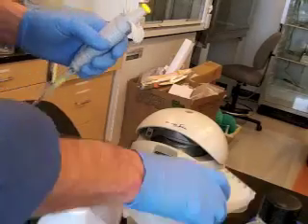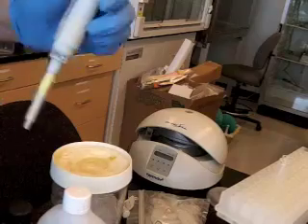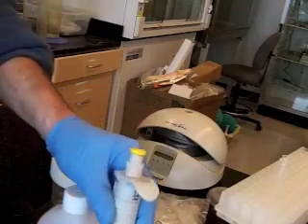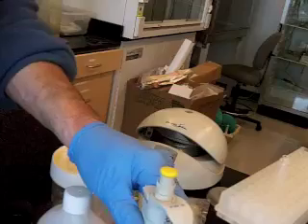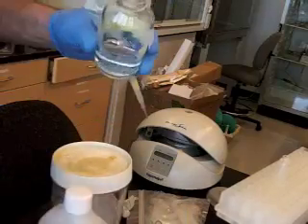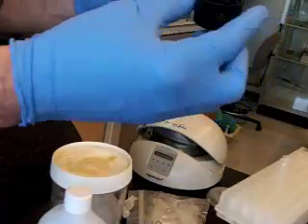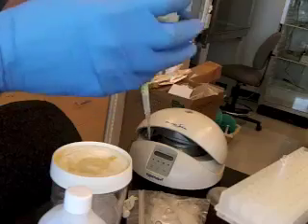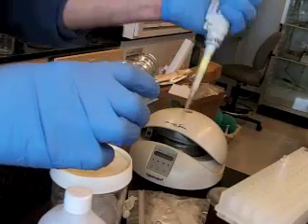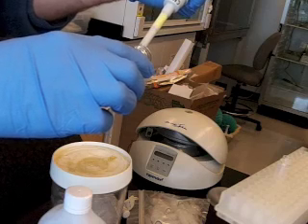And these are disposable tips, and so it's pretty common to just get rid of them, right? You weren't ready to use it, so just throw it away. And we use quite a few disposable tips. So here's some liquid. We'll pipette this first. Take the cap off. Set the cap down like in that position, because we're going to keep the inside clean and the cap part dirty. Tip this at an angle. Push this down to the first stop, and try not to put the pipette shaft in.